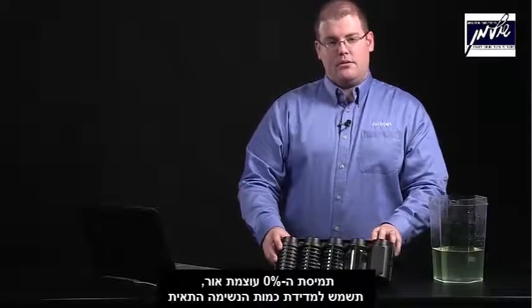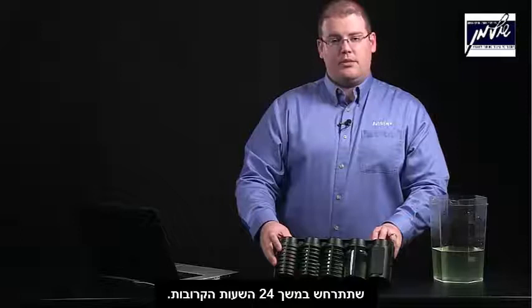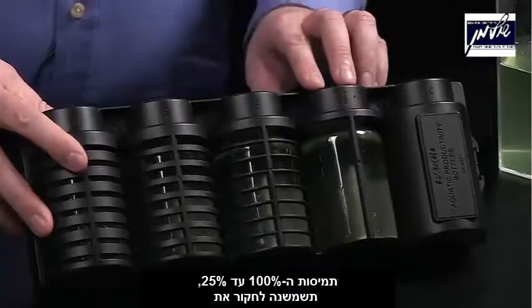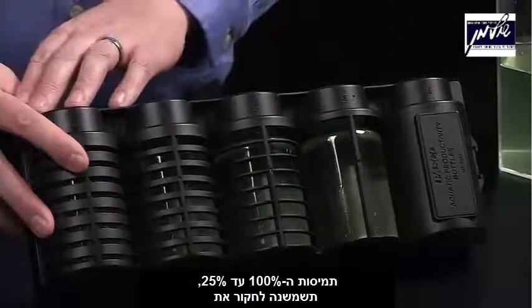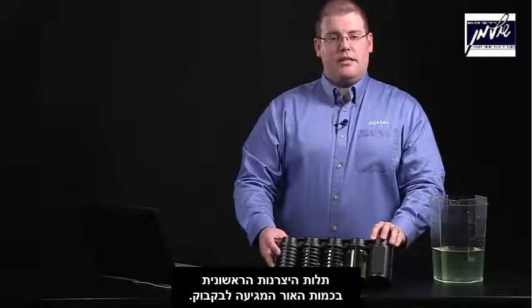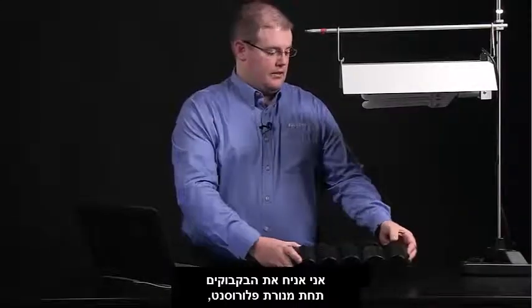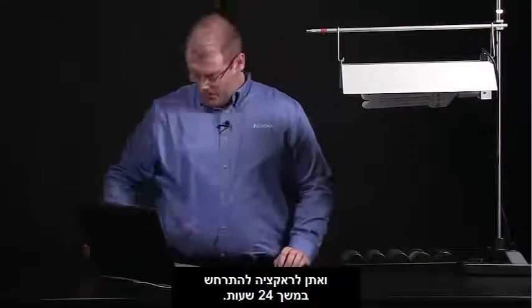The 0% solution will be used to calculate the amount of cellular respiration that occurs in the next 24 hours. The 100% through 25% solutions will allow us to see how primary productivity varies as a function of the amount of light that is allowed through. I will now place the bottles underneath a fluorescent light and allow the reaction to progress for 24 hours.